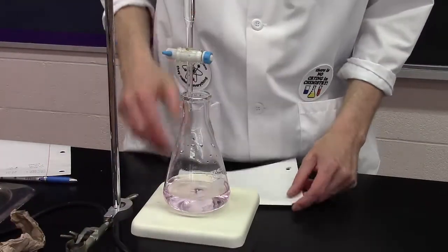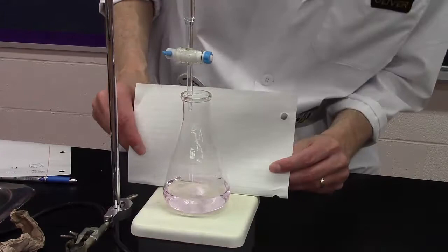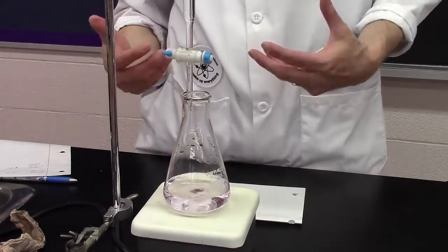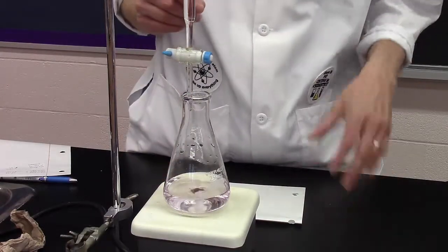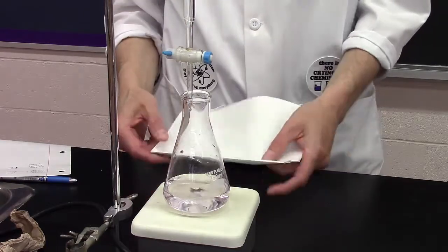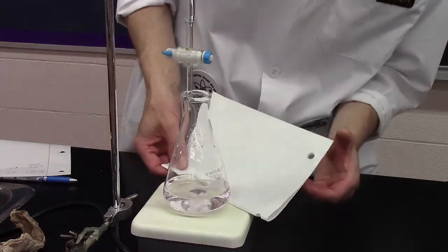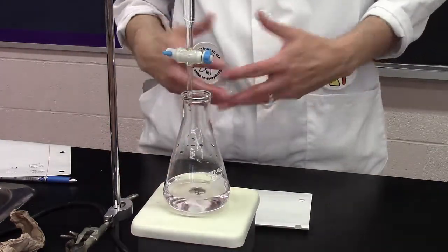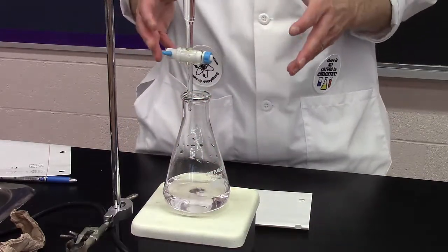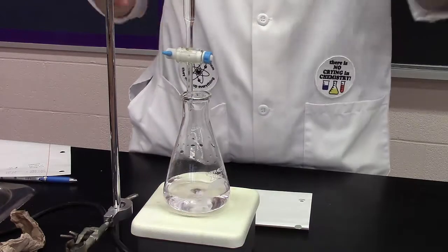I don't know how well you can see it, but that is a very faint pink - at least it was, it's now faded a little bit. What I'm going to do is add a single drop more. Right now to me this is a faint pink, although nope, it's gone colorless. I had it to a faint pink, but as the added base found those last few molecules of acid to react with, the color went away.